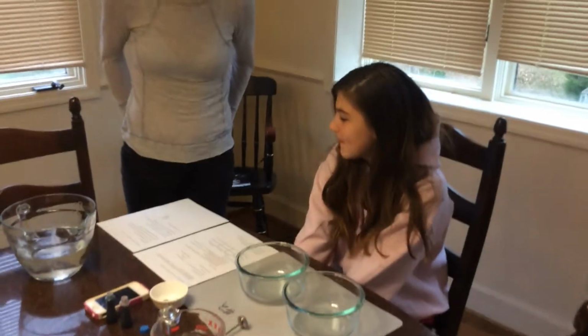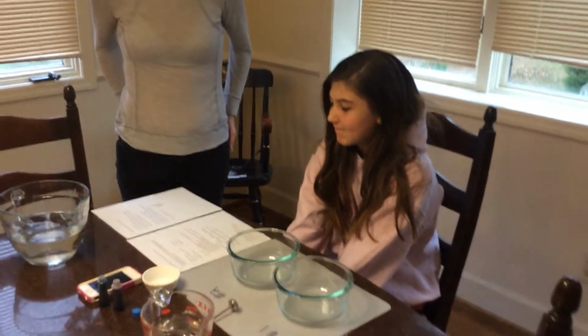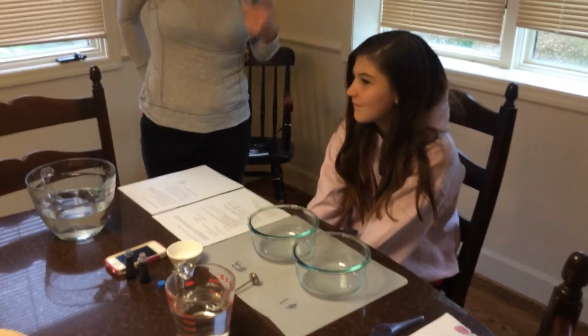Okay, the experiment that we're going to be doing today is going to involve testing the rate of diffusion. And this is Celia, and Celia is going to be doing the experiment.